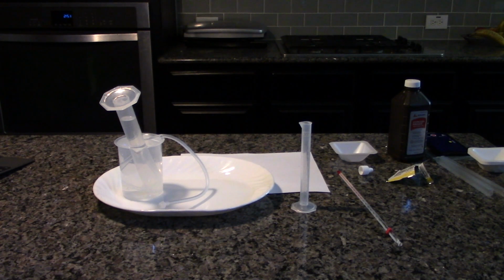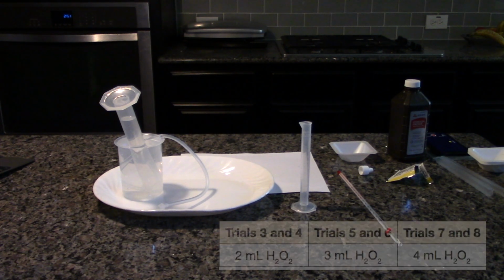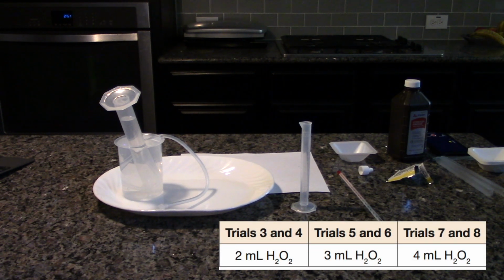This is trial 2. Repeat the activity varying the volume of hydrogen peroxide as listed in the table below. You will complete a total of 8 trials.